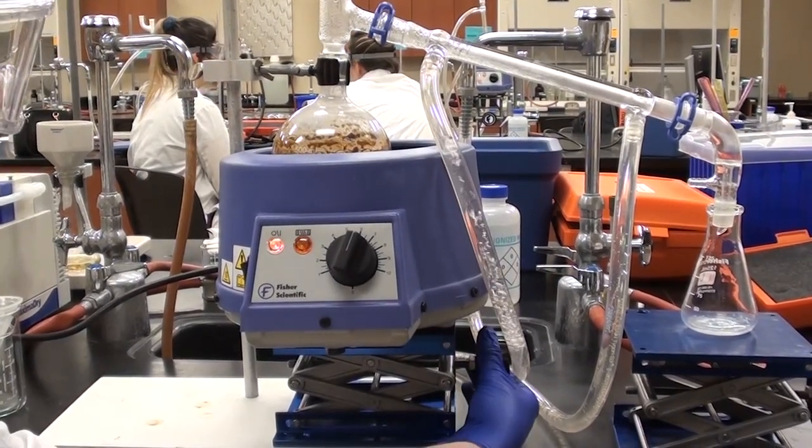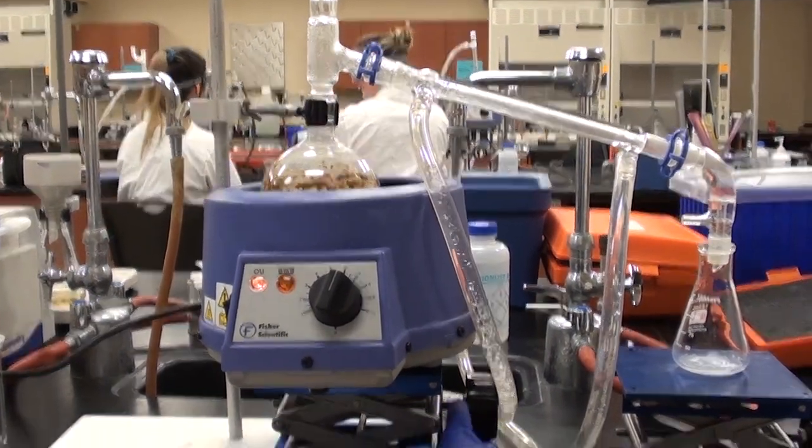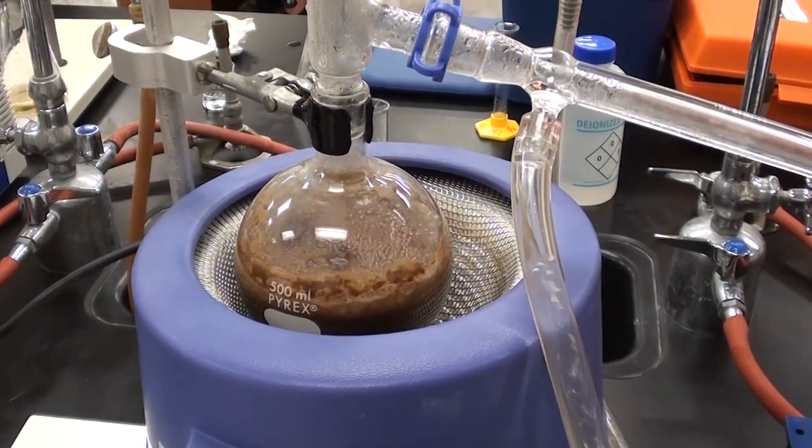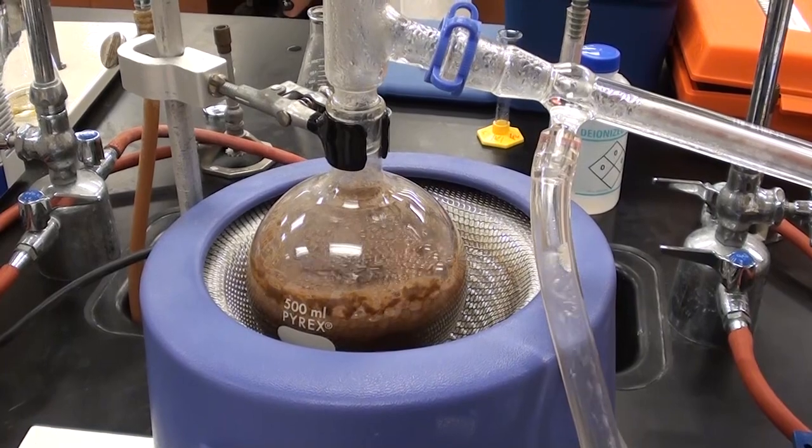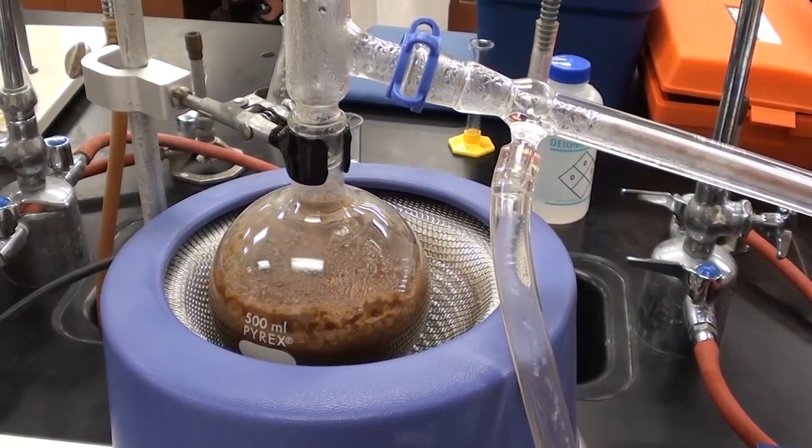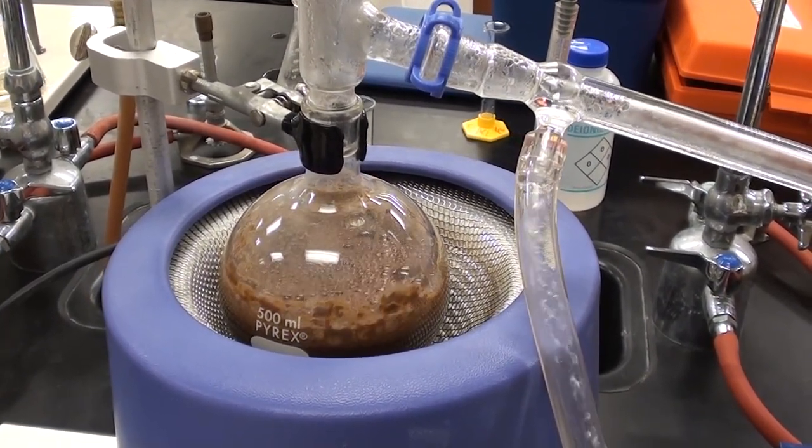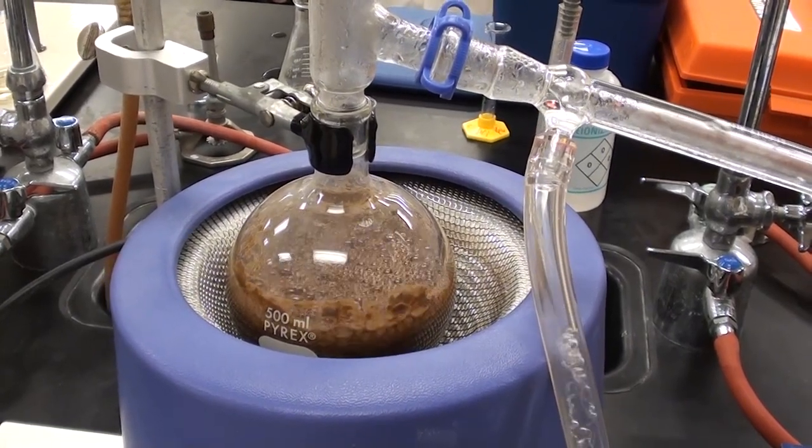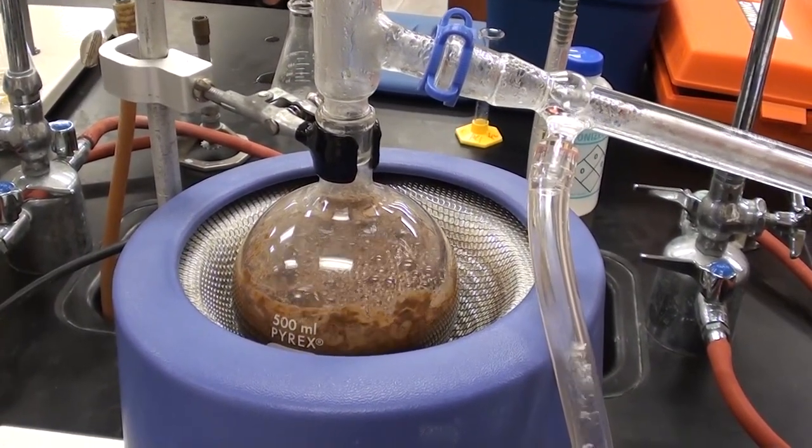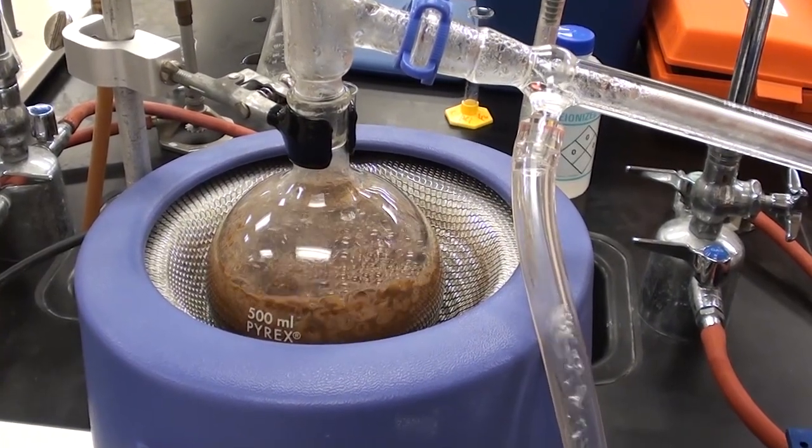Cassidy's going to go ahead and raise this a bit more now. She's waited a few minutes here before raising it. It does look like it's still behaving. Now by behaving, I mean it's not foaming over, and that's really important. As long as it's not foaming over, you can continue to raise it. You think it's completely in yet? Not yet. Almost.